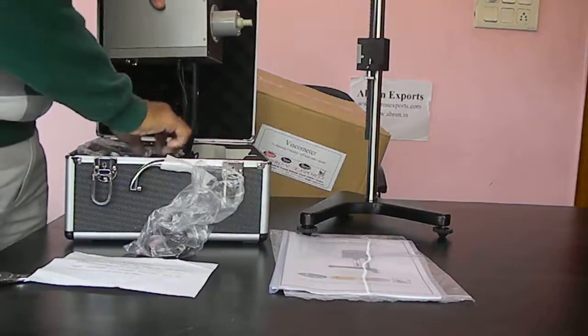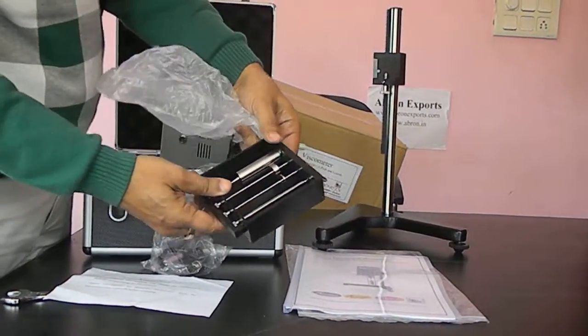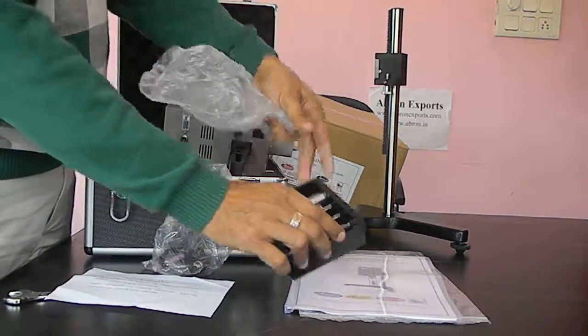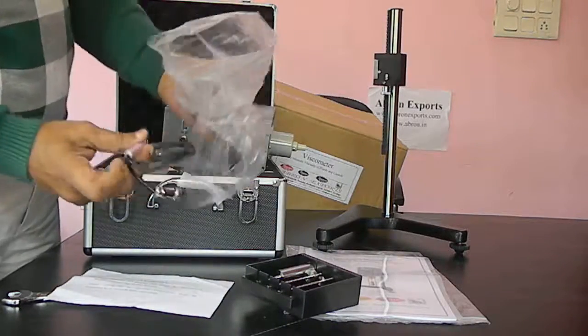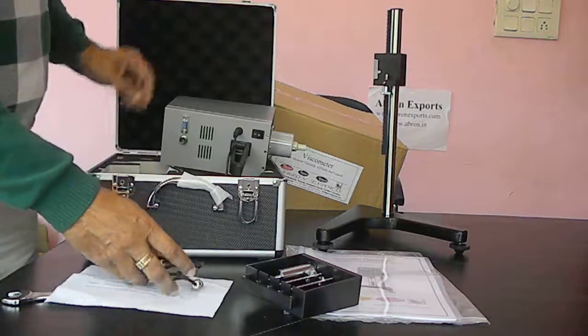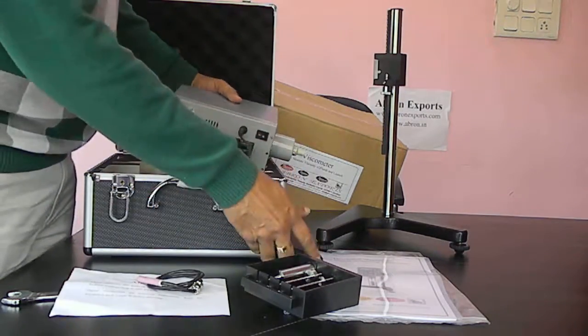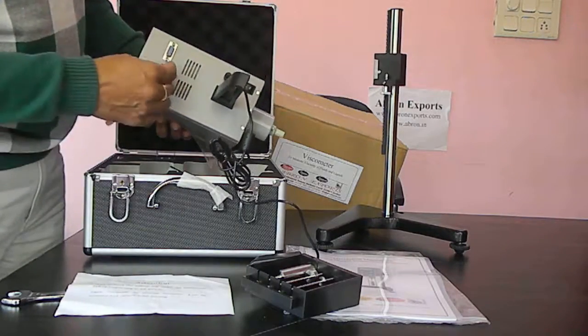Then there are different viscometer accessories provided. Different viscometer one, two, three, four. There is a cable to connect to the viscometer. And this is the power supply. There is one connecting cable here. You can connect it using this.